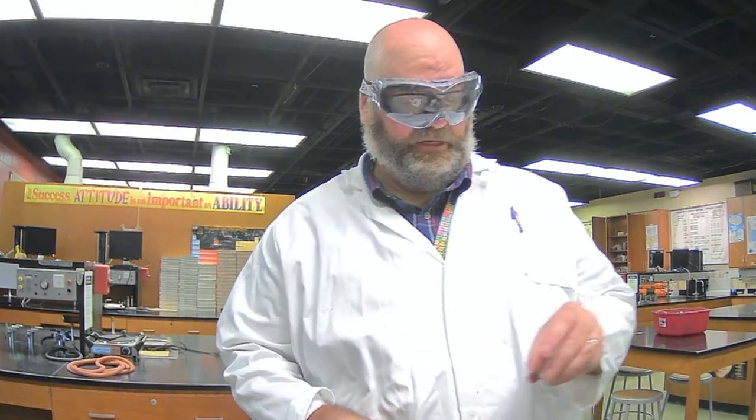Okay, so I'm going to do the old pennies first. All right, there is going to be a difference in their density. So you want to make sure that you are aware of that as you write down your measurements and do your calculations. Okay, so these are the old pennies. So I'm going to get their mass. Their mass is 18.58 grams.